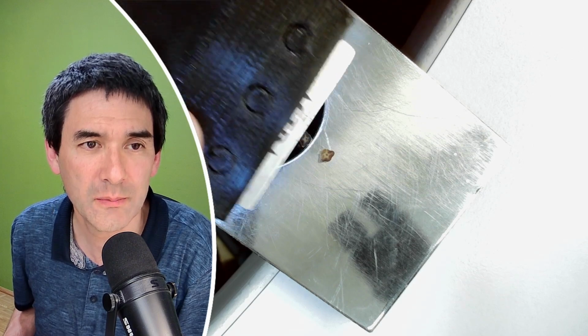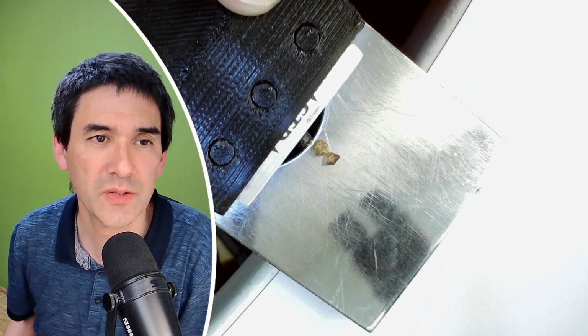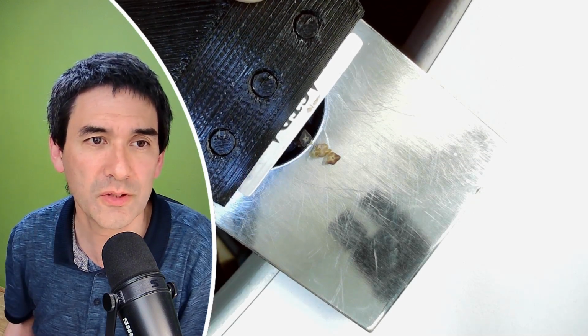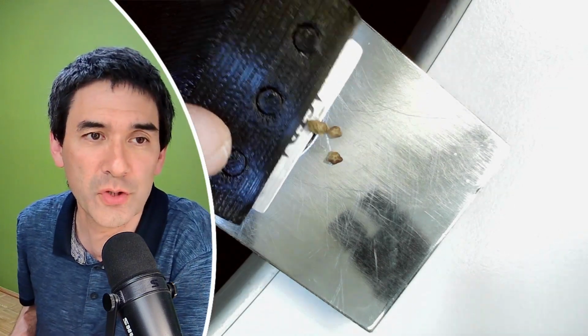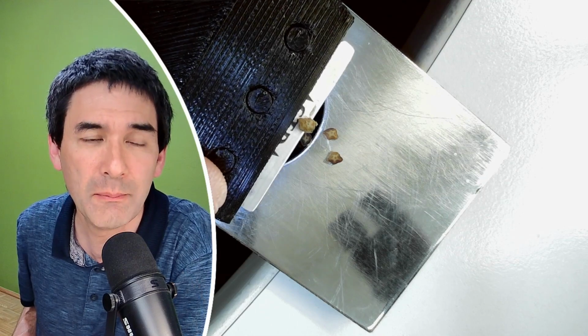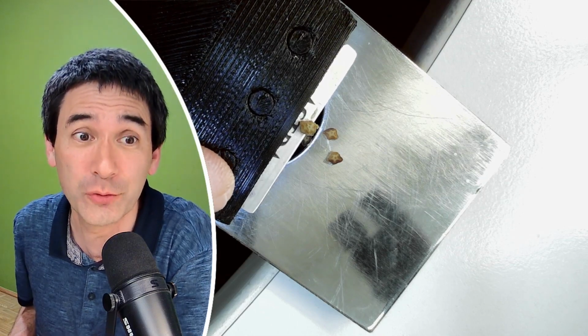Yeah, see, I'm still sliding over it, so it did not advance enough. Yeah, this one cuts very smoothly and very lightly. This was a very thin one now. So I think I like this one, as expected, the most. First of all, I have a lot of stability because the angle of the blade is always the same. It's a sharp blade, of course, and because it's a disposable one, I don't have to sharpen it.